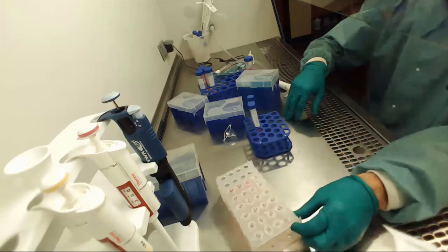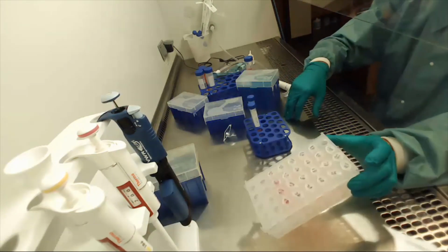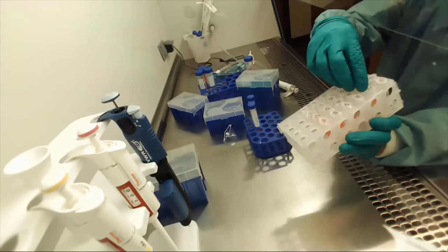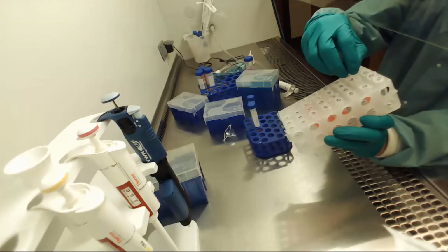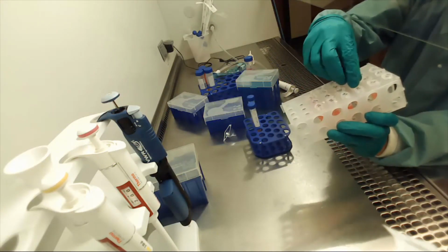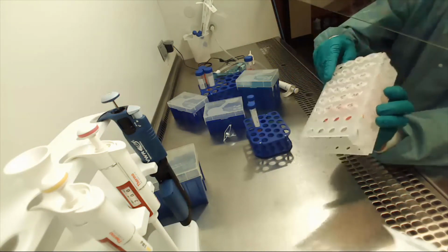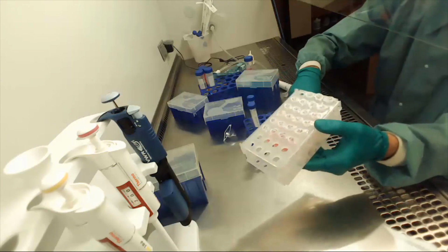All right, so we're done. I know this was a long day. Here's all our dilutions, and you can actually see the bleached one was purple, and then it just totally bleached out the color for 8%. The 4% still has some color. That's pretty funny. But so these are the chemicals we're going to add.